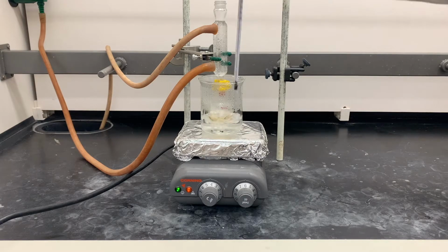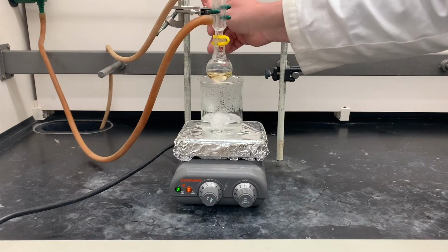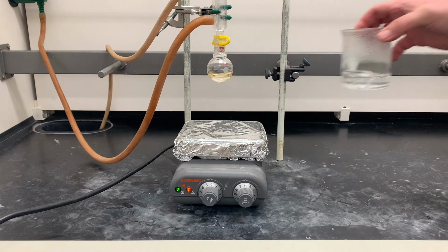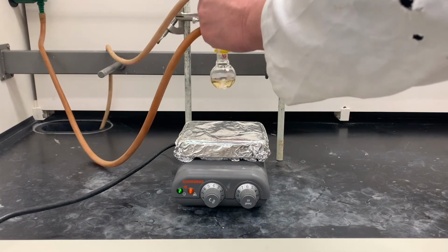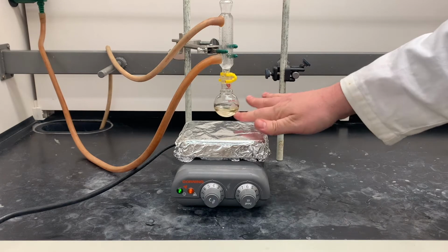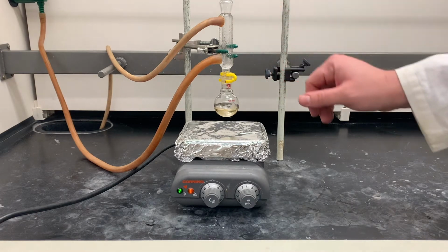We'll pull this out and put that to the side, let it cool. But as much as possible, I want to keep stirring this. And I'll just leave an air gap here until it cools. I'm going to leave the water on in case something evaporates so it still condenses.